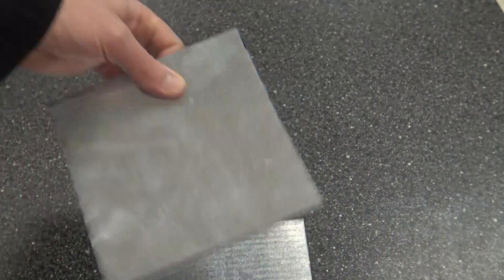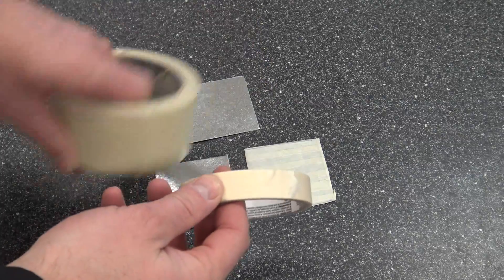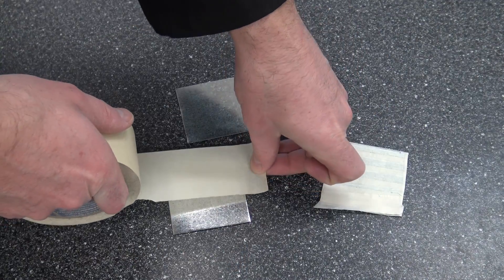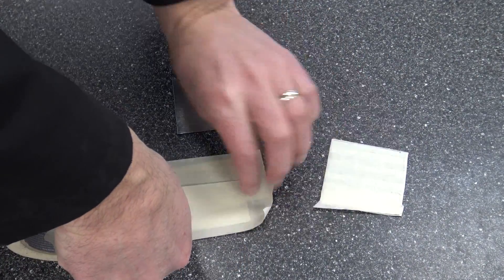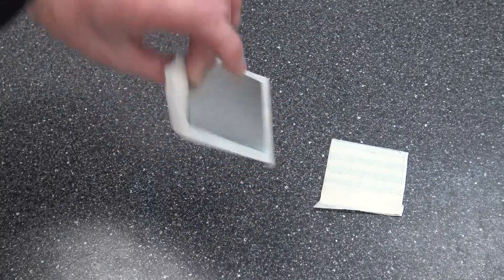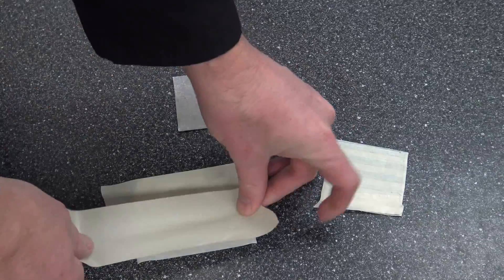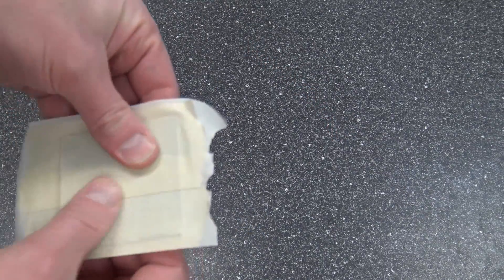We're gonna cut it up into small pieces so that we can make ornaments out of this and we're gonna completely cover it up with masking tape. This is gonna go in an acid bath pretty soon so we need to have it all the way covered up. So get it covered up really good and then press it down nice and firm.